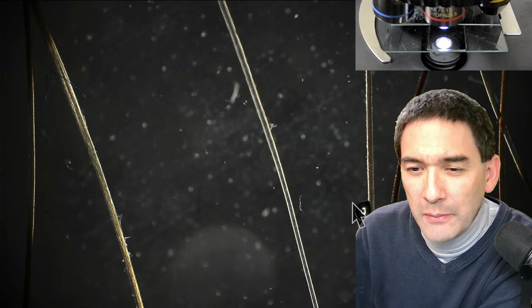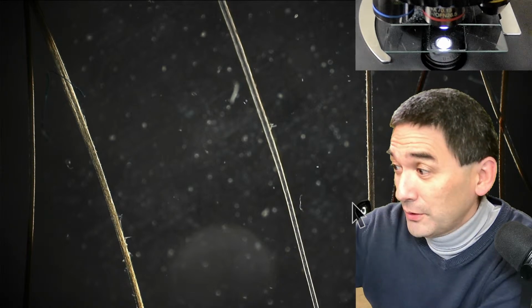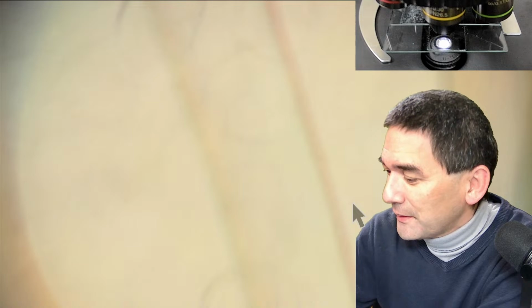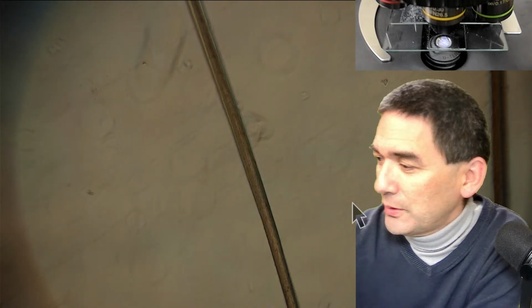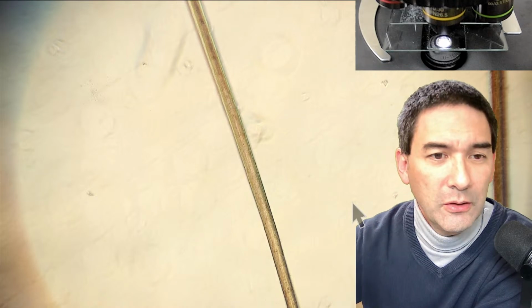Next question: I'm African, would my hair look different in comparison? Look, I'm not forgetting about the question. Look at this, how different the hair looks over here. And I've got students from all over the place, right? So would the hair look different?